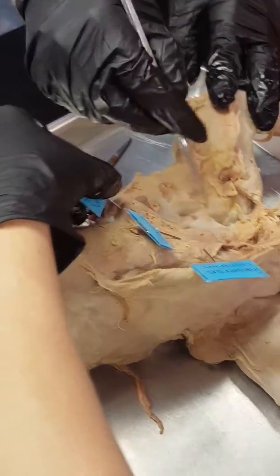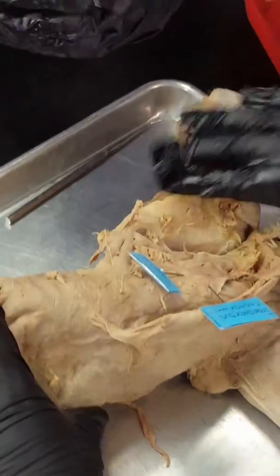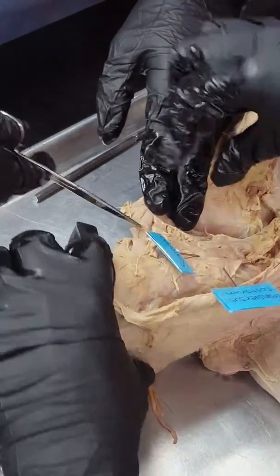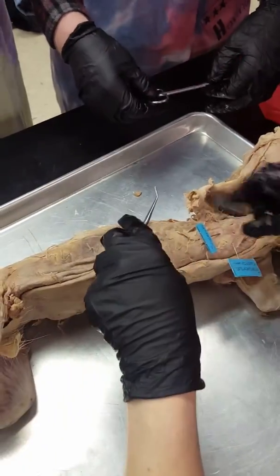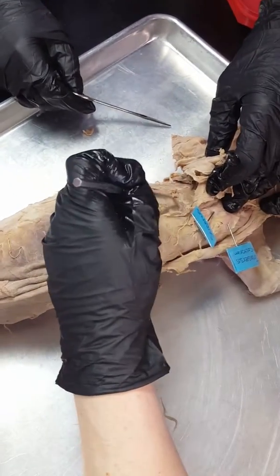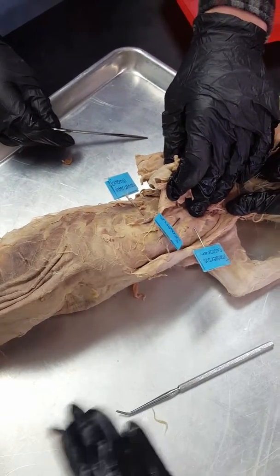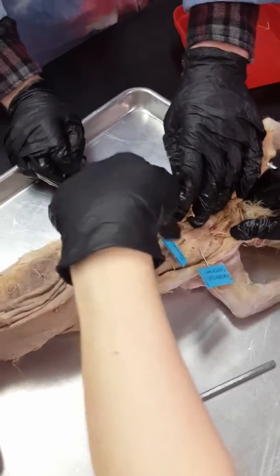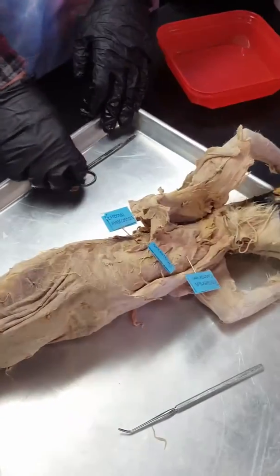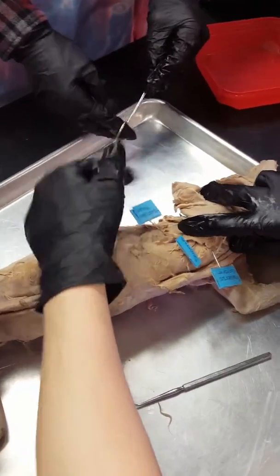To find your intercostals we're going to have to snip a couple of the pieces of serratus ventralis. He's snipping serratus ventralis and then we're going to tilt it. Right here — see this kind of soft tissue — that is the external intercostal, and this is the rib meat. We don't eat cat rib meat, but when we eat cow or pork ribs that's what we're getting. The tissue is really tender because the diaphragm is constantly moving — constantly tenderizing it — so it's very soft tissue.